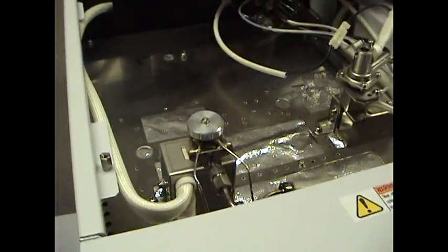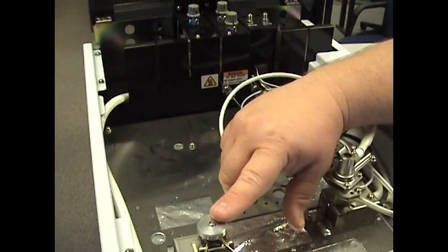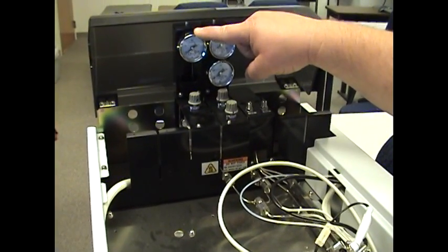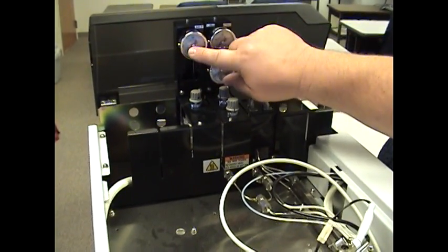Also, very important, before you remove the SEPTA nut, look at your makeup gas. Make sure that reads zero.